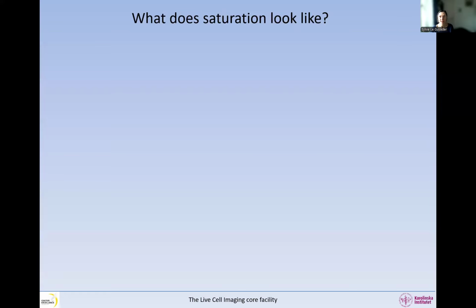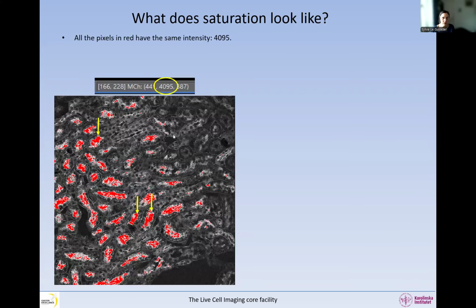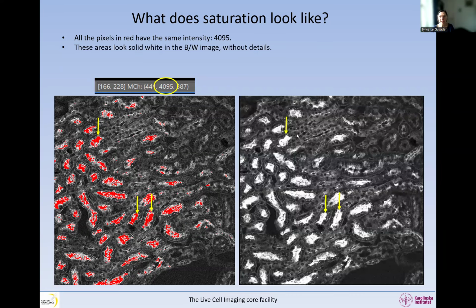So 4095, what is the problem with that? These pixels are saturated. So what does saturation look like if we look a little bit more in detail? This is what it looks like if we go a bit closer, and all these pixels that are color-coded in red have the intensity 4095. They all have the same intensity, whereas it's extremely unlikely, or pretty much impossible, that in reality all these pixels have the same amount of fluorescence everywhere. Clearly, the intensity would change everywhere. So when we remove the color mask, what we can see is that these areas are like solid white. There are no details at all in these areas.